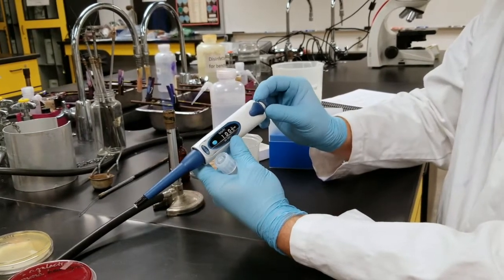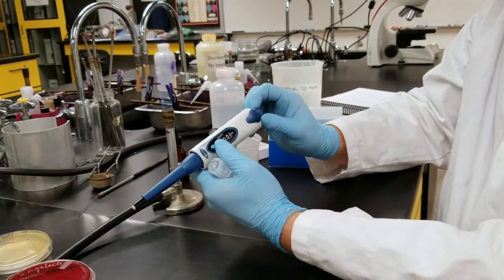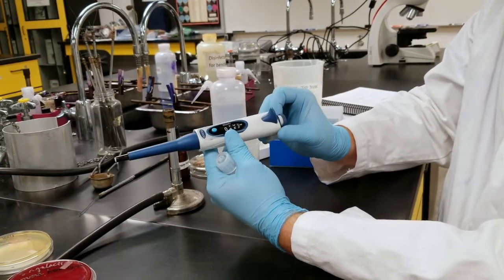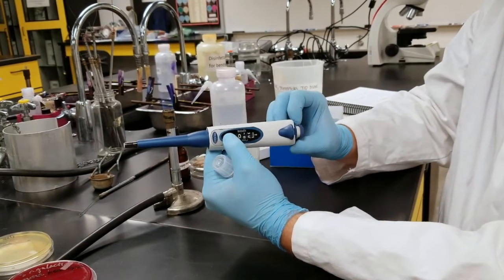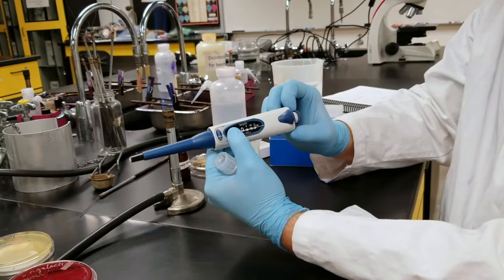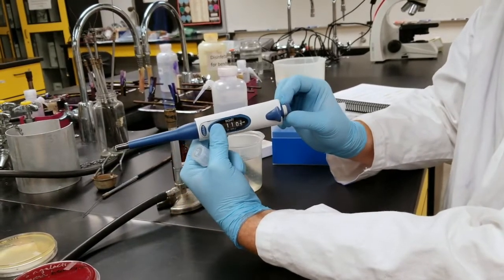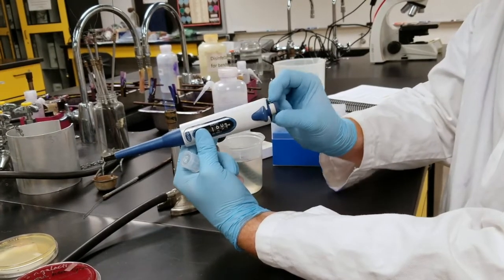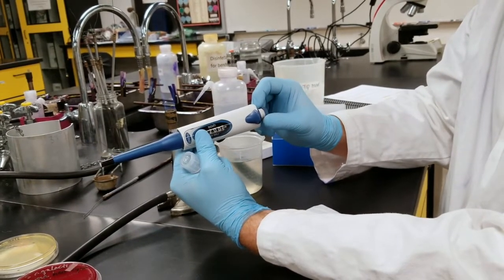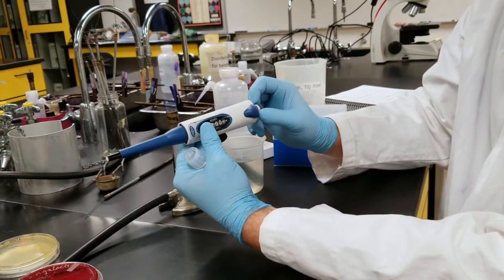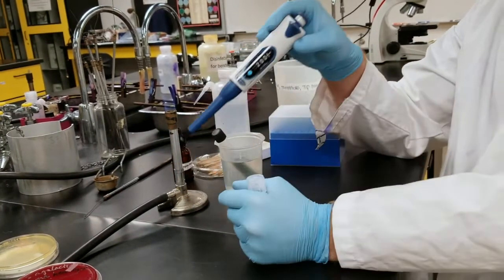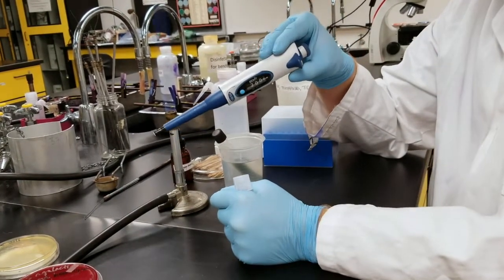To move this, I have my dial. For this particular pipette, this blue button is to lock or unlock it. I depress the blue button and then rotate the top knob until I have 200 on my dial. This will pipette 0.2 milliliters or 200 microliters.